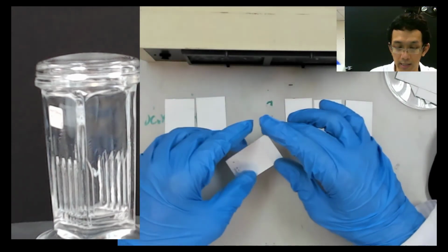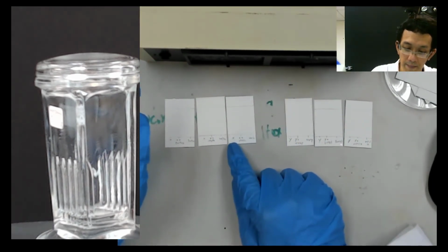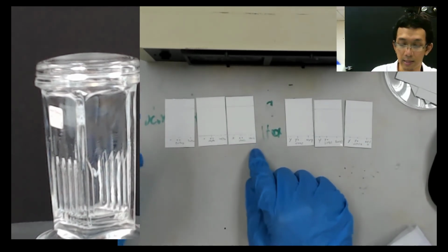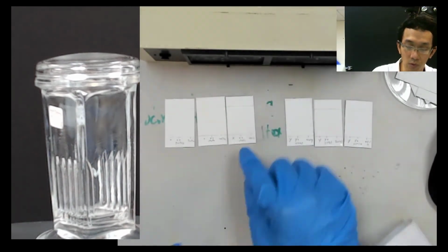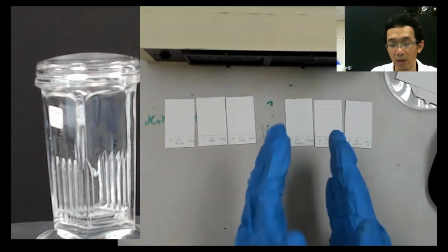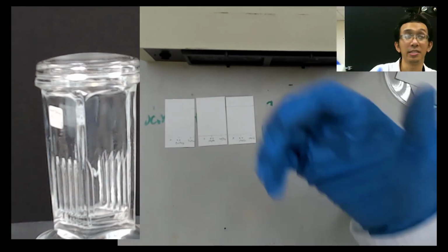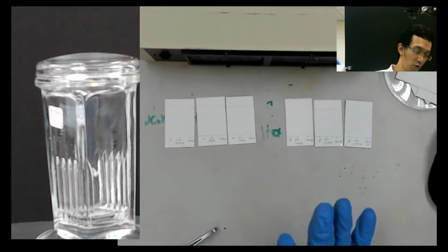So that's the idea. Staining is okay, you just need to be very specific, and for each compound you have a different staining agent. You need to do one TLC only for X, one TLC only for Y, one TLC only for Z, and so on. So it will take a lot of TLC, and at the end, the cost of staining will outweigh the harm of the UV, because you can block the UV using plastic.